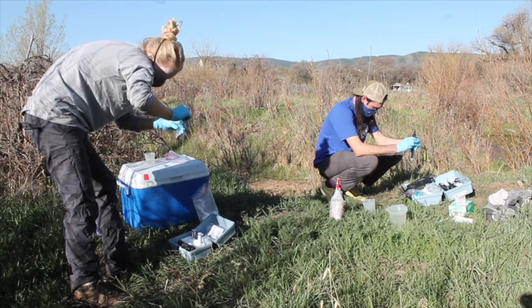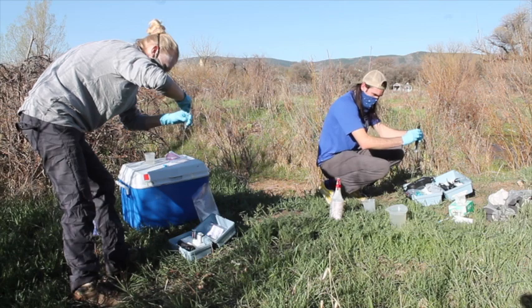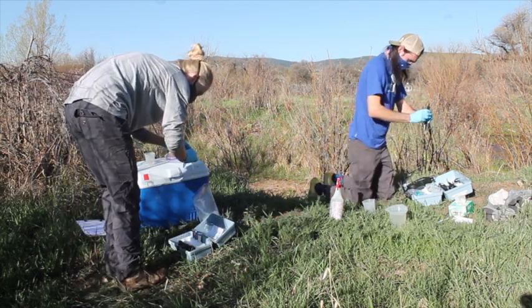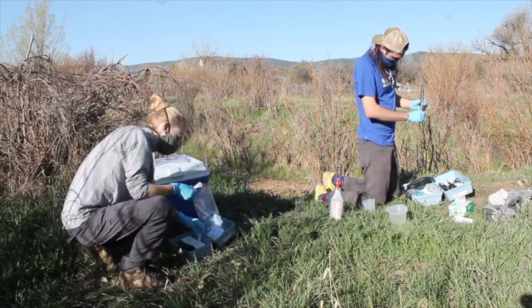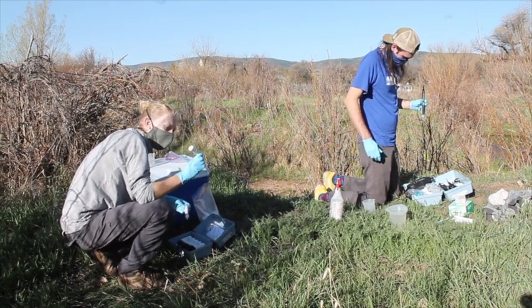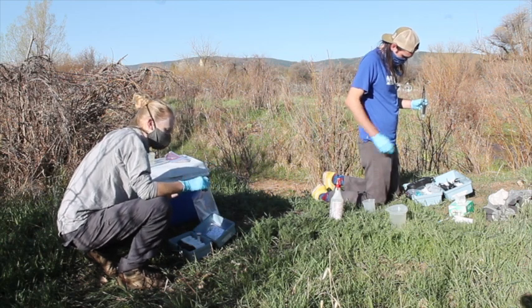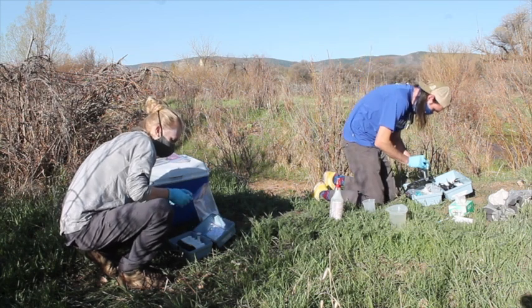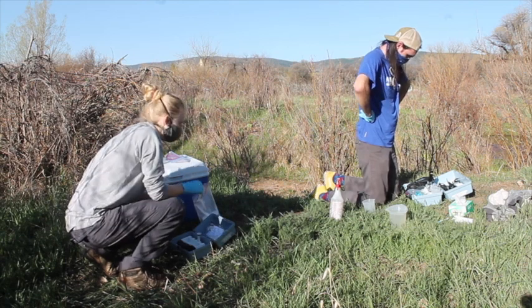We're going to get our trusty burette hook. I'm going to do the 0.16 concentration of acid — a smaller concentration since I don't expect to need too much for this sample.